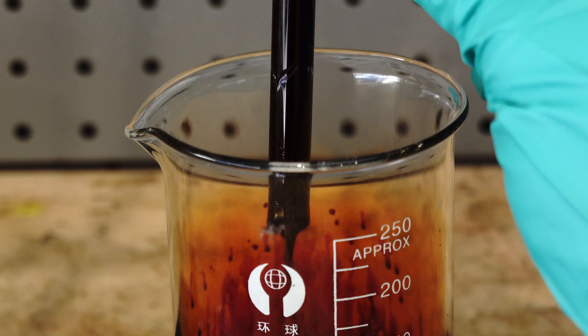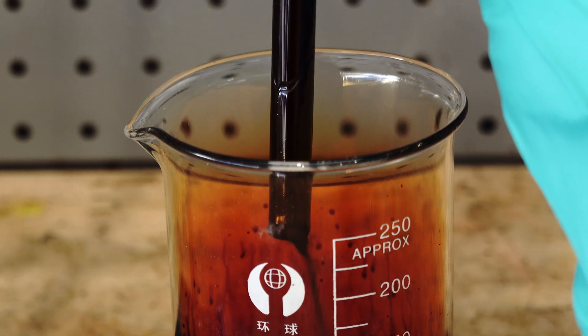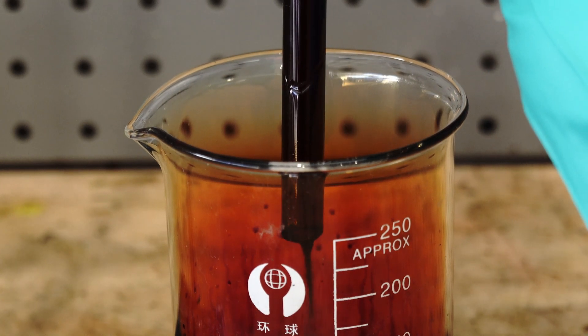Our Bromine may still have some sulphuric acid in it, which has a chance of interfering with reactions. So we need to redistill this.